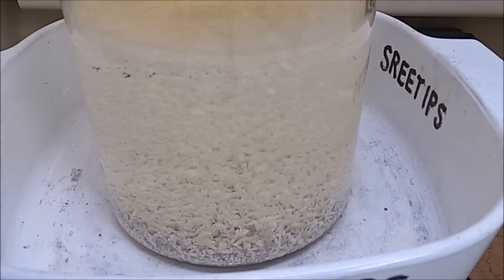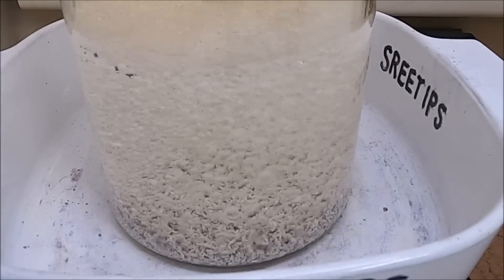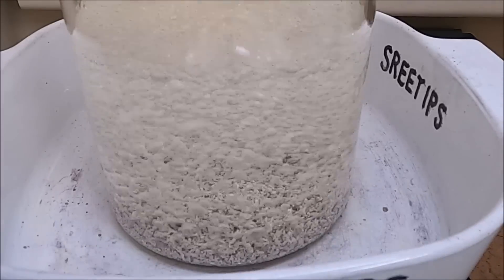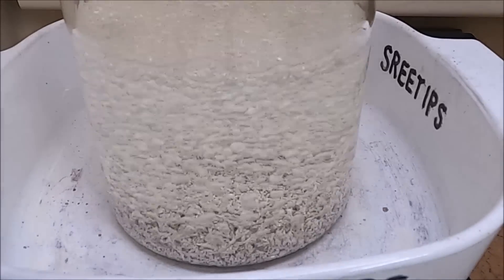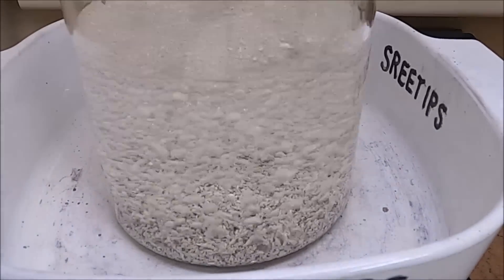And what that blue color is, so I've been told, is with the nitric acid in there it reflects the light a certain way and it appears blue. Here the reaction is nearly complete and you can see that the electrolyte is clear and colorless.